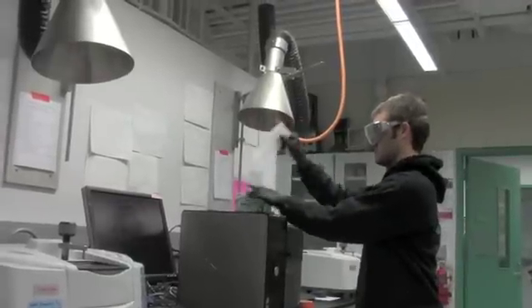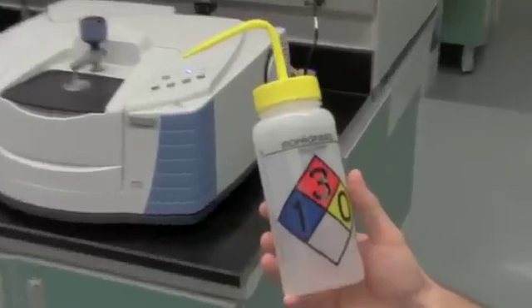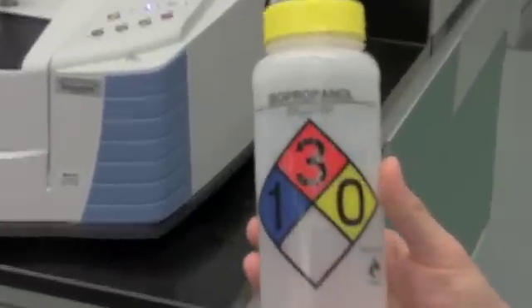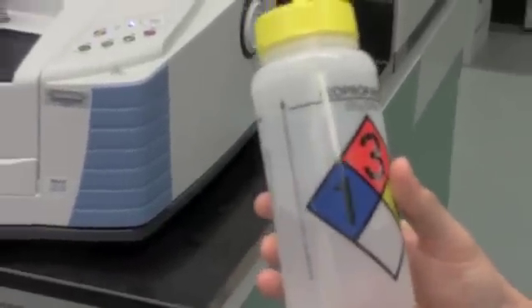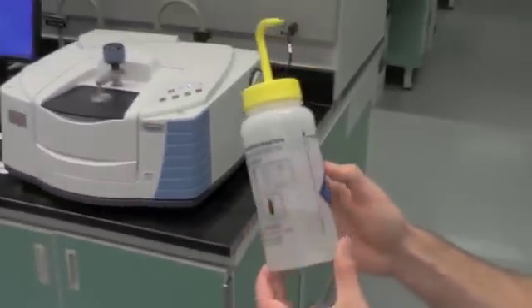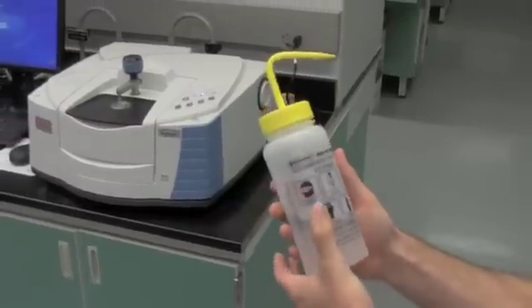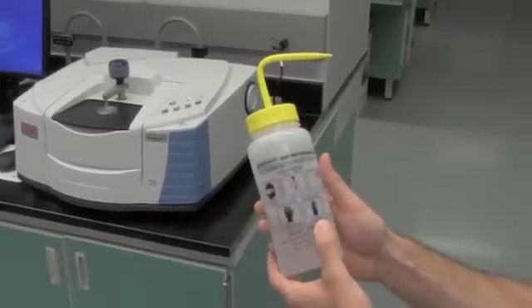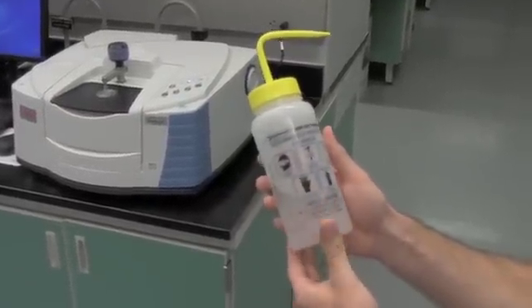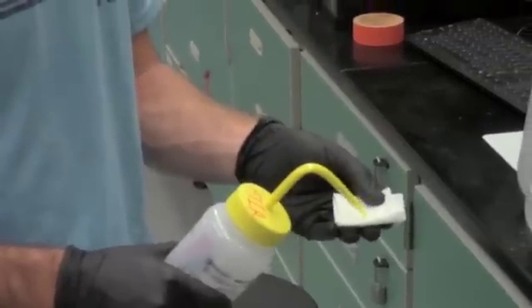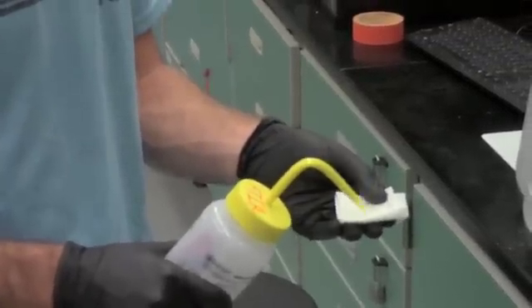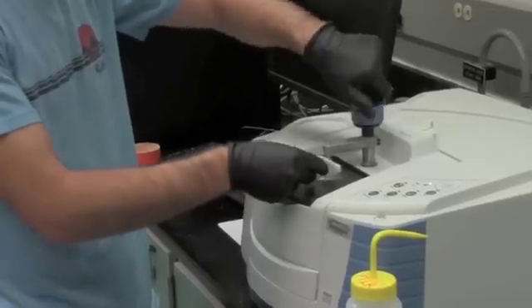The FTIR machines should only be cleaned with alcohol. Bottles of isopropanol are located next to both machines. However, the solvent should not be applied directly, as this could damage the device. Instead, first apply the alcohol to a chem wipe, and then wipe down the machines.